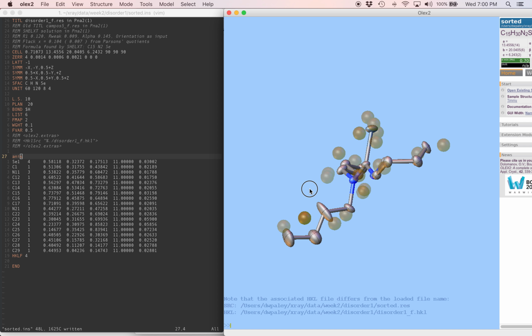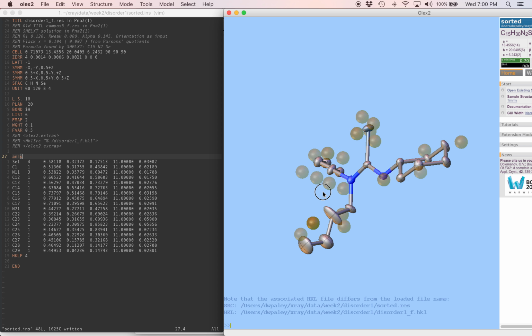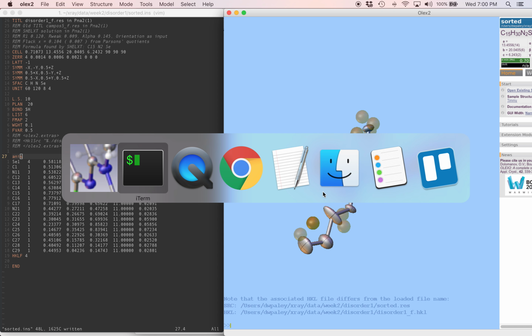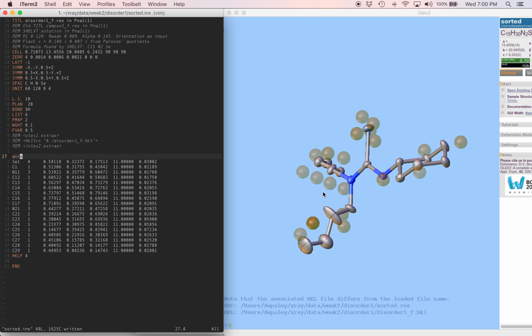Really, for any atom, they don't normally vibrate like that. They don't vibrate so far back and forth. So the most likely thing is we're looking at a disordered chain. So I'm gonna go through the steps that we discussed for modeling disordered chains. We're gonna get started by making those atoms isotropic again.